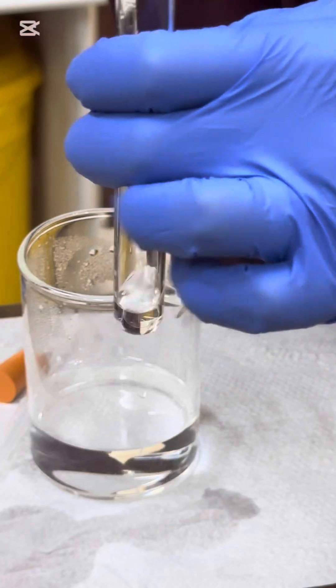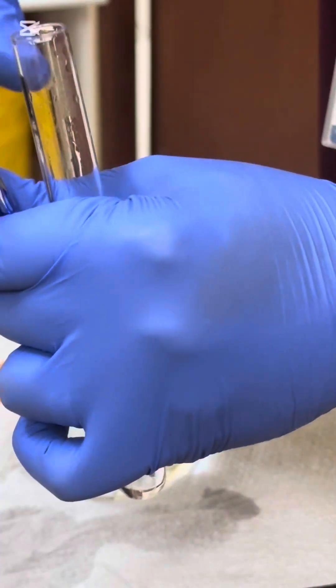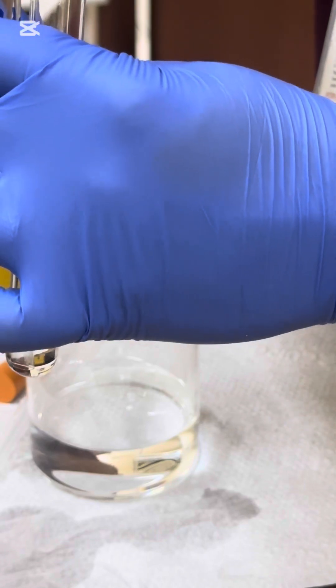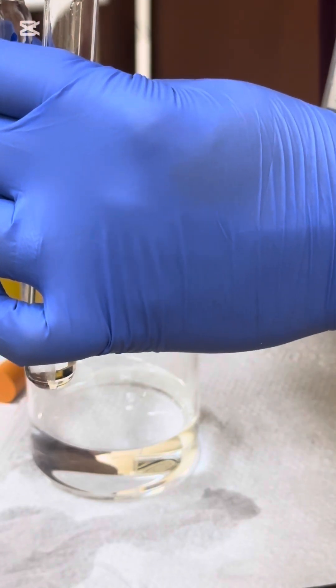So, this is the oxidation to a diol. We're going to be using an oxidizing agent called potassium manganate 7 in acidic conditions. That's what I'm preparing right now.